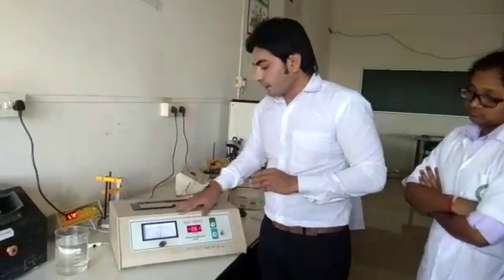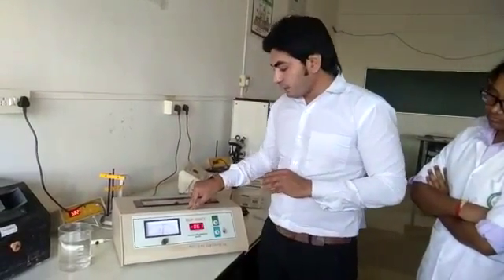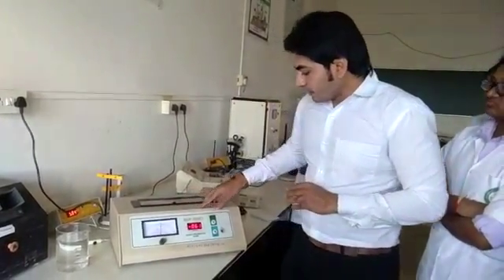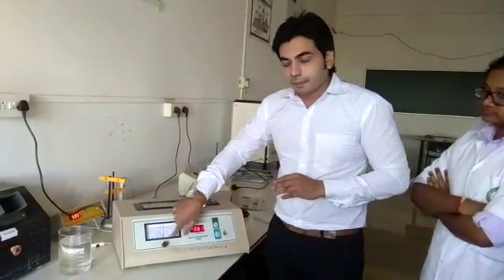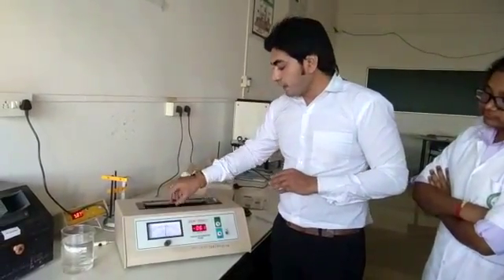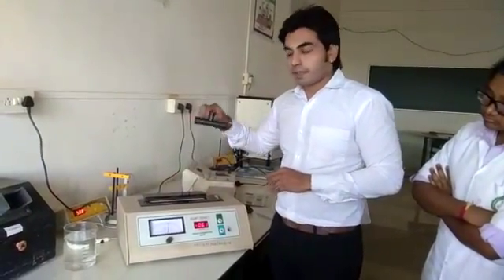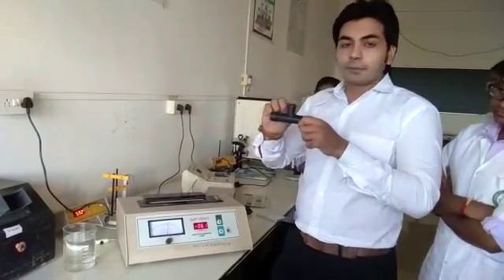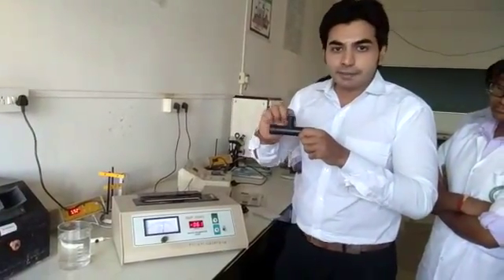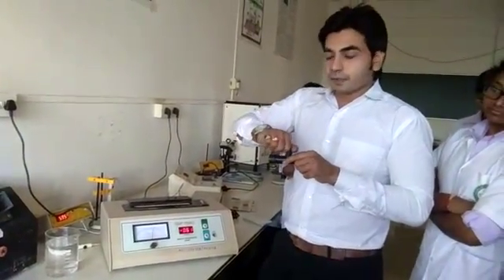Now let's see the different parts of this instrument. This is called the intensity meter. Here is the sample holder, where you can place the sample you want to analyze inside this particular tube.